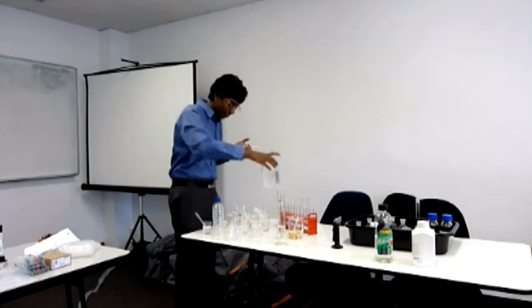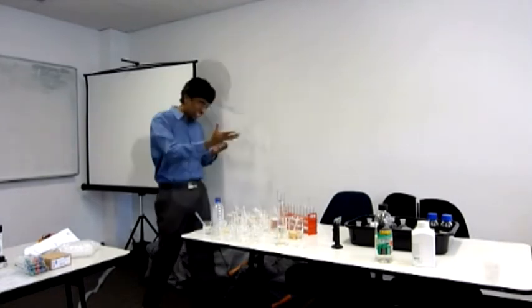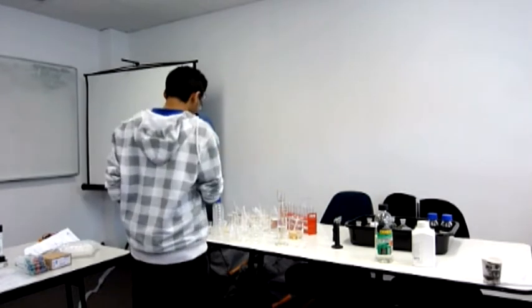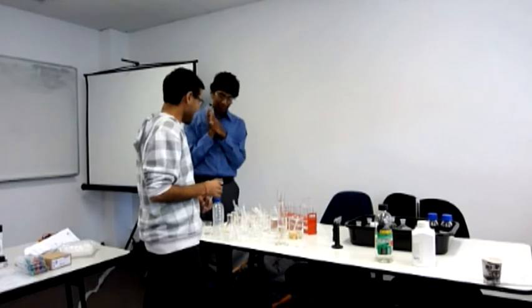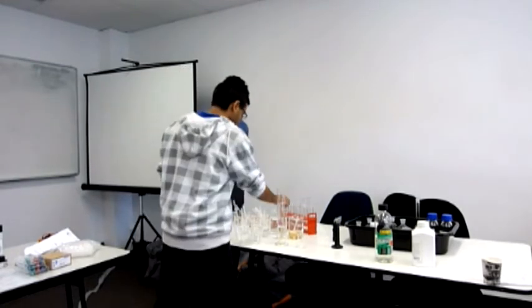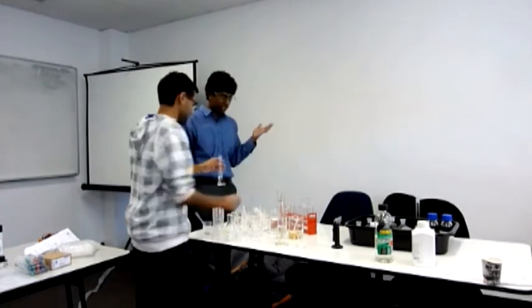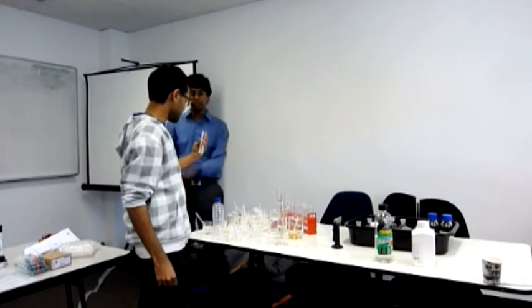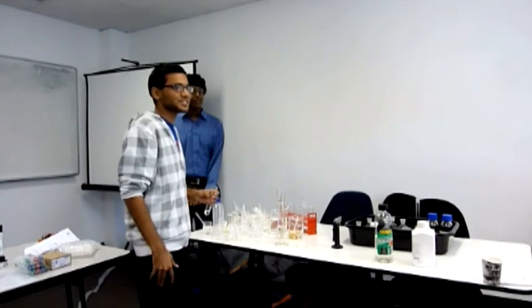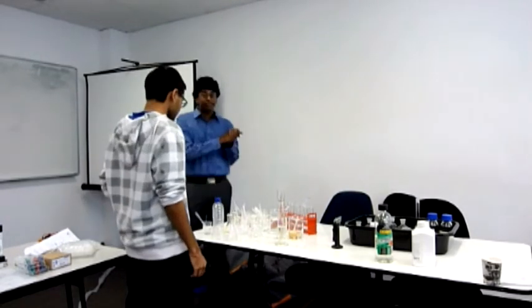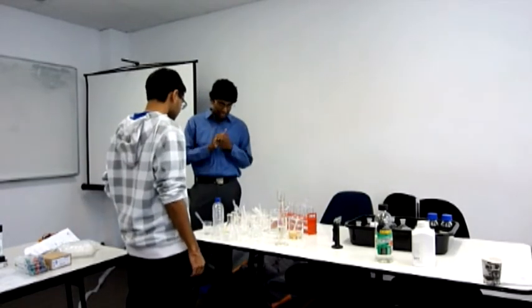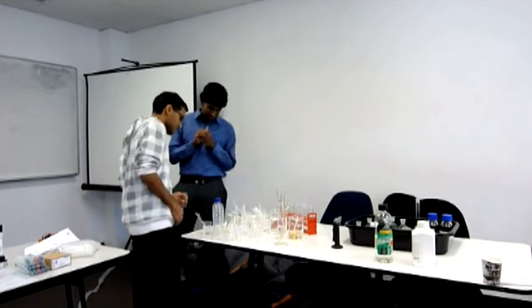First test is we're going to take that. Anion solution, fill it up. Drop it in there. What's next? What are we doing to that? What are we testing first? Nitric acid. So what are you going to add? Nitric acid, exactly, makes sense.